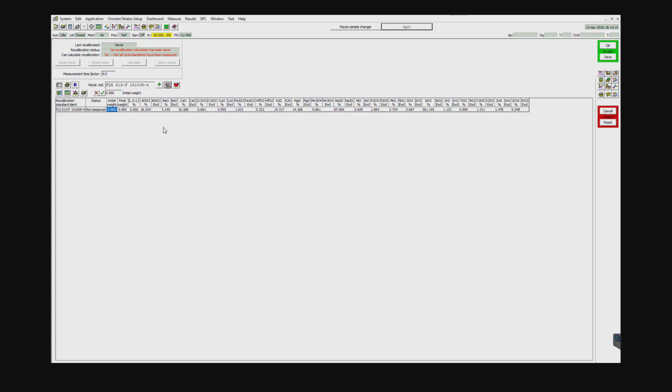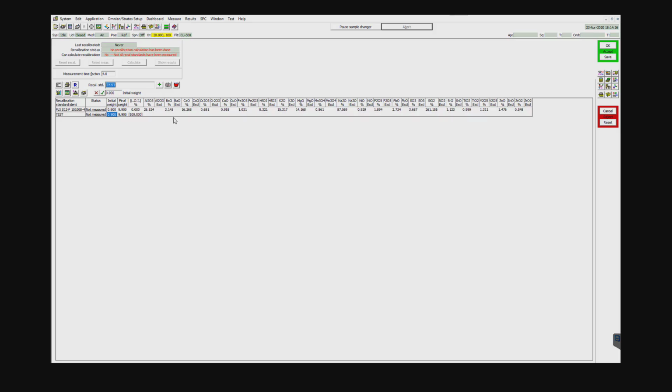I don't really want to correct for intercept, which is D. However, if you wanted to, again, you could add another one. You can manually add samples here. Let's just say if I wanted to add a test sample, you could add it like this. And then I would have to run this sample because I have no measurements. I would have to run it against the curve itself to get actual concentrations in here.